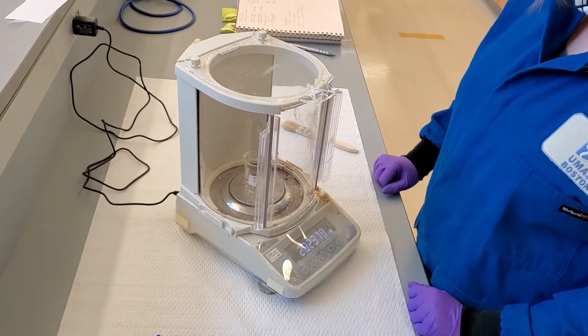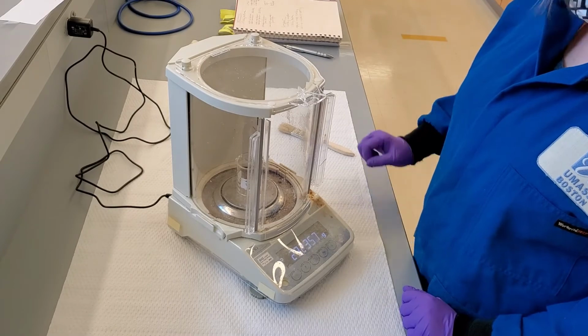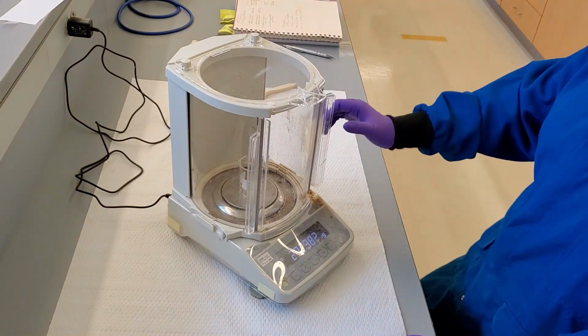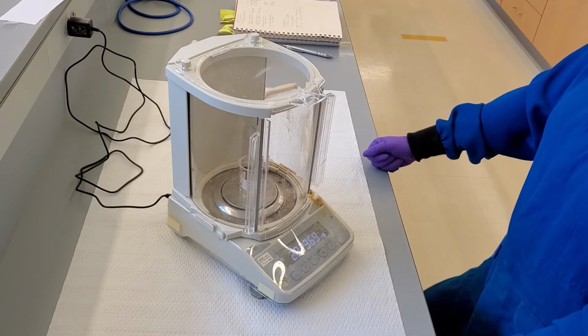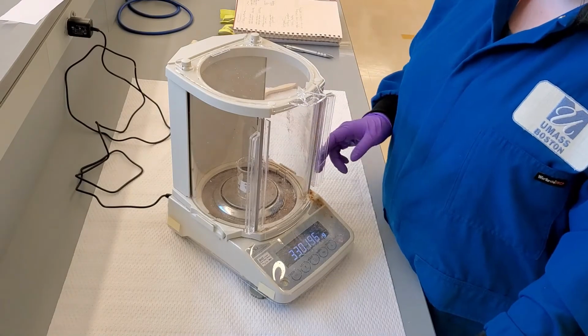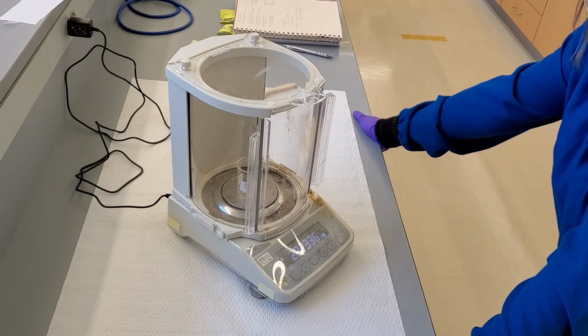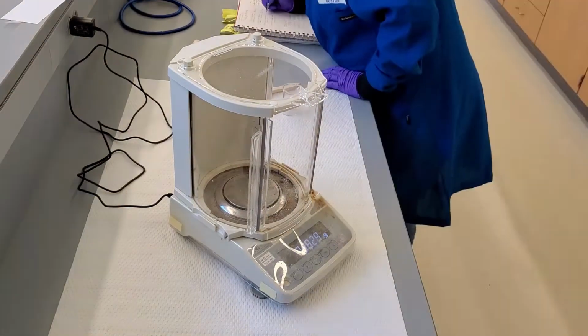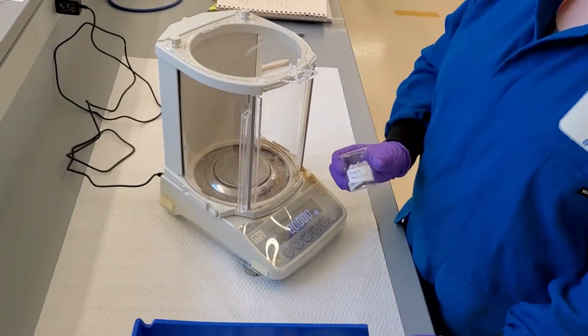As we wait for both sets of pure crystals, we need to weigh the clean, pre-labeled beakers that we are going to transfer them into. We make sure the balance is at 0 grams, place the empty pure naphthalene beaker on the balance, close the doors, wait for the numbers to stabilize, and record its weight. Then we repeat the process for the empty pure salicylic acid beaker.